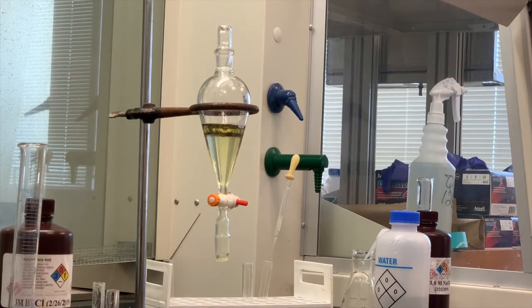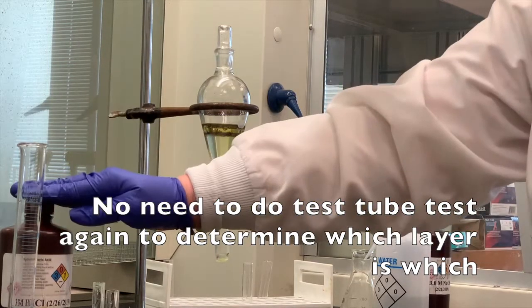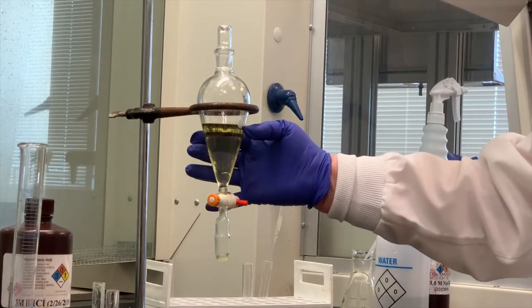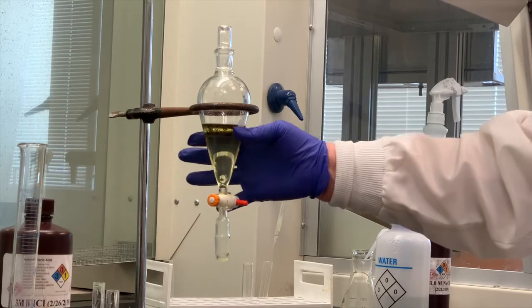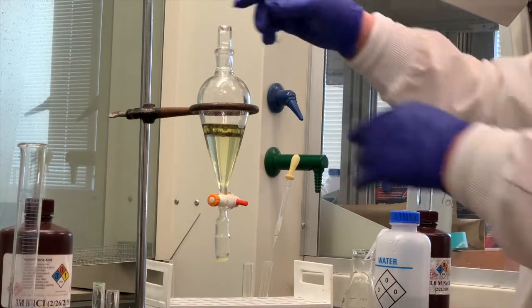And that could be due to the p-nitroaniline, as far as where we purchased that from. Sometimes it's not 100%. There might be some impurities in the p-nitroaniline as well. So now we don't have to test this again if we use the same hydrochloric acid that we used before. Remember, we said that the top layer was the aqueous layer and the bottom was the organic, so I don't have to. If you want to, you can take the time to do that test tube test again. But if the organic was on the bottom, washing it with acid, it's still going to be on the bottom each time you do that.